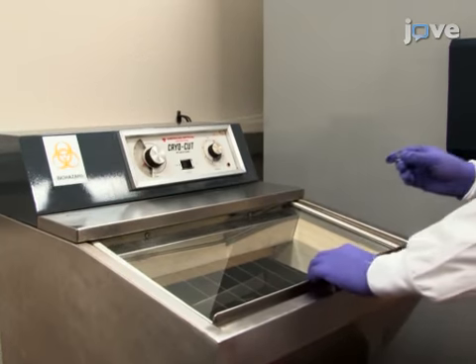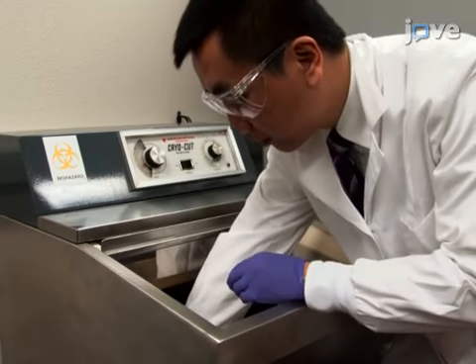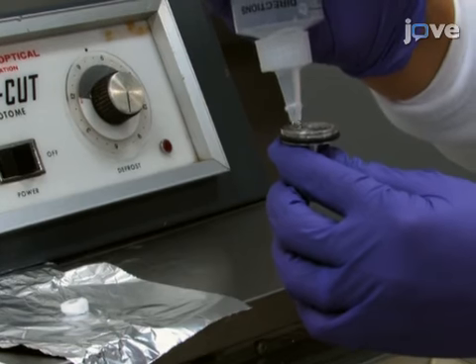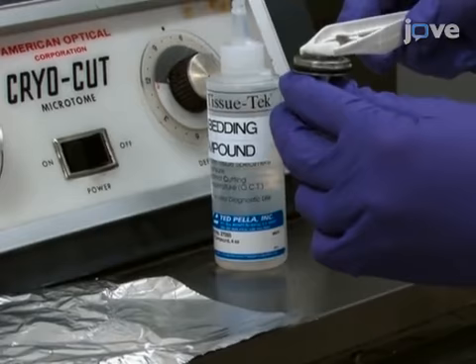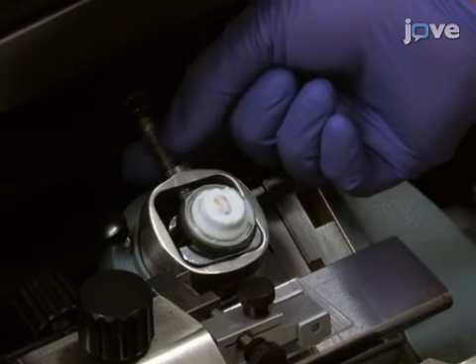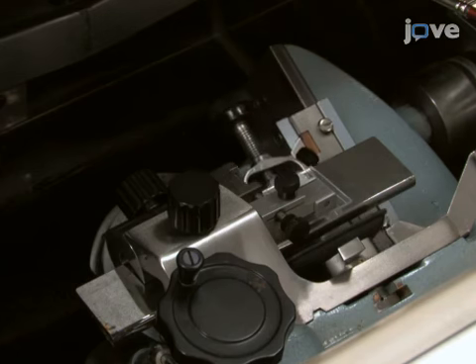To prepare the mouse tissue section, take the frozen mouse organ and thaw to minus 15 degrees Celsius in a temperature-controlled cryomicrotome. Secure the tissue onto a steel base with approximately 500 microliters of tissue embedding compound and place onto a cryomicrotome sectioning mount so that the desired sectioning orientation is presented to the knife. Section the tissue to a 12-micron thickness.